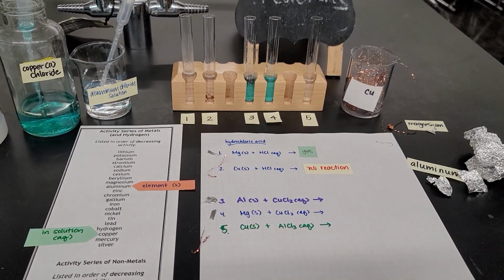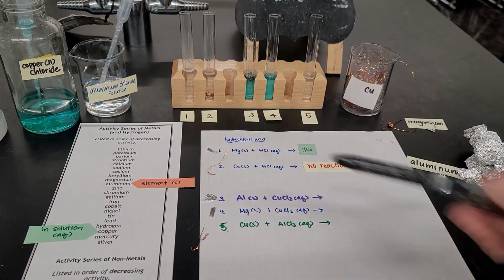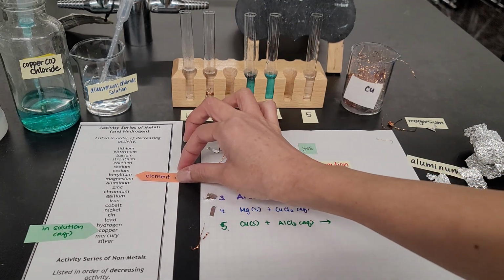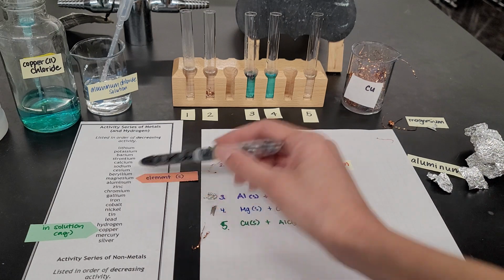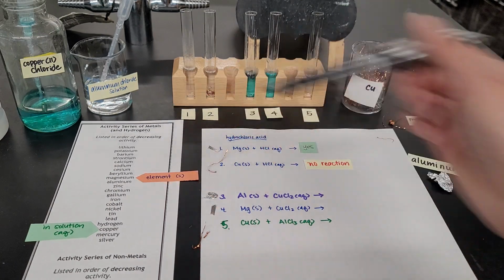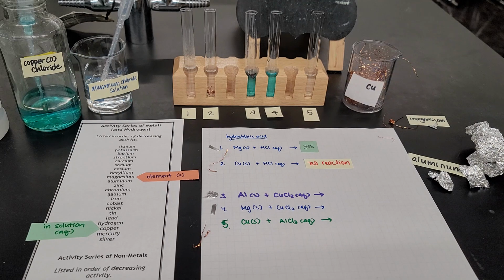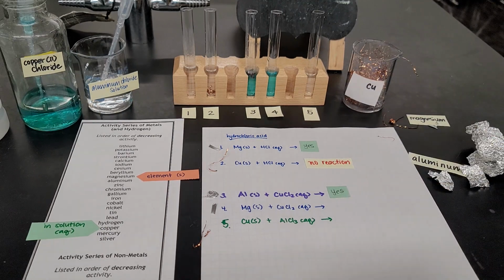Let me go straight to reaction number 4. Looking at magnesium, magnesium is even more reactive than aluminum. Aluminum was by itself over here. Magnesium, the next reaction that I want to test, is right above aluminum in this chart. So we would predict that yes, a reaction will take place. Oh, and let me fill out reaction 3. So yes, a reaction took place for reaction 3. You see something brown here.